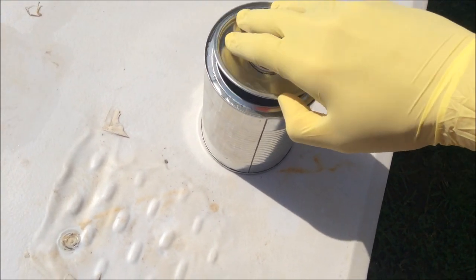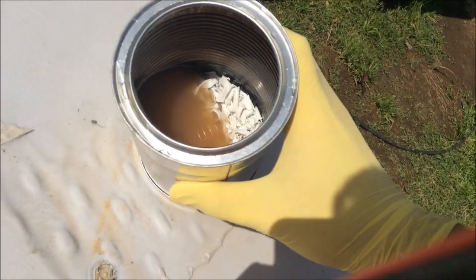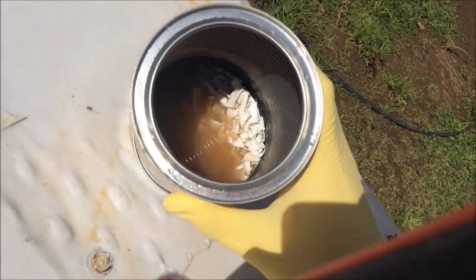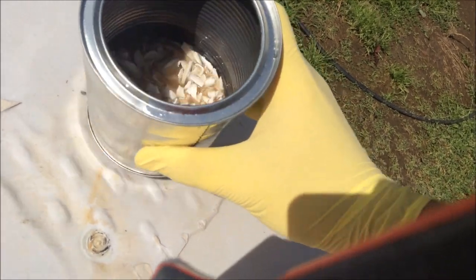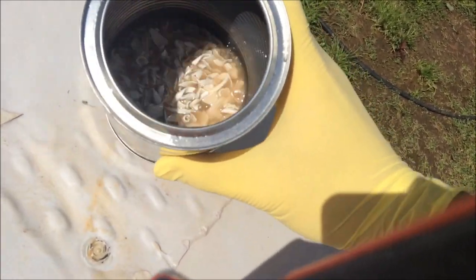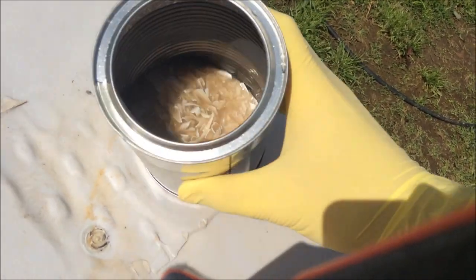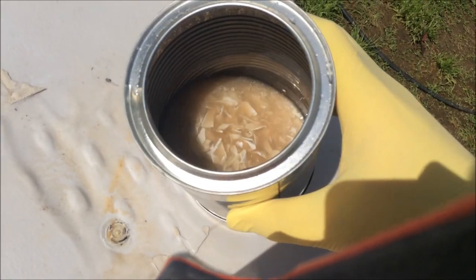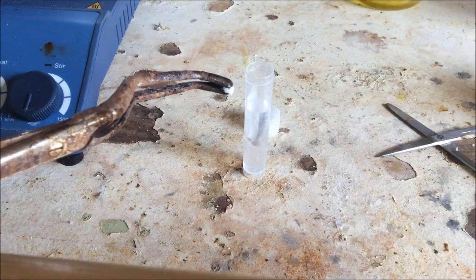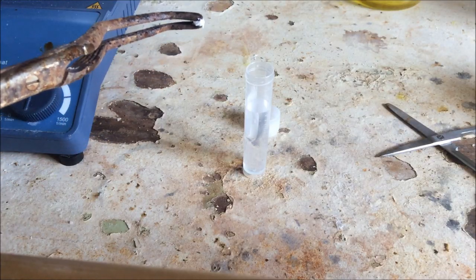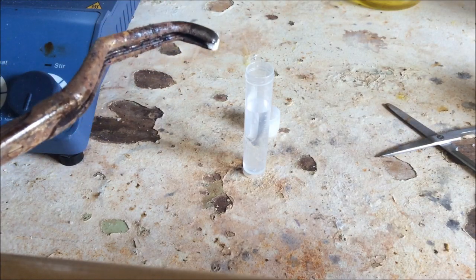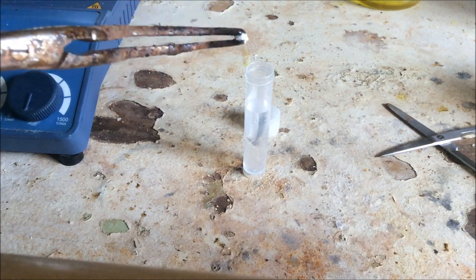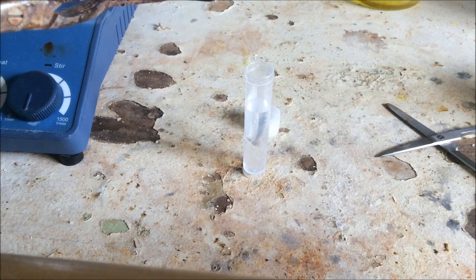There's this horrible soupy brown liquid on top of these white bits of plastic. Now I'm hoping that these bits of plastic I can just crunch and they should all just be sodium terephthalate. So all those pieces of plastic in there are no longer plastic. They're really fragile white things. And hopefully they're actually all sodium terephthalate, which has reasonably low solubility in ethylene glycol, I'm fairly sure.